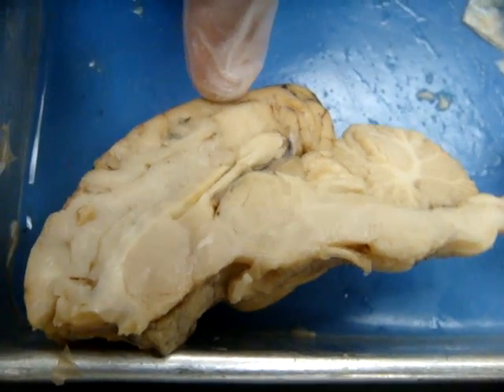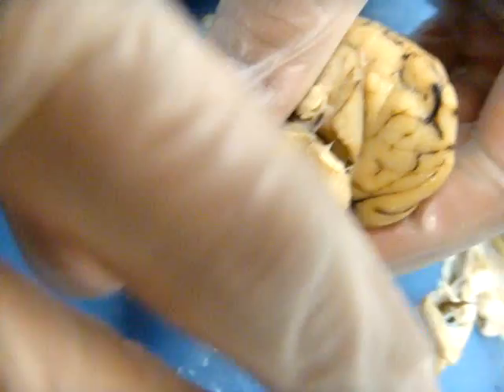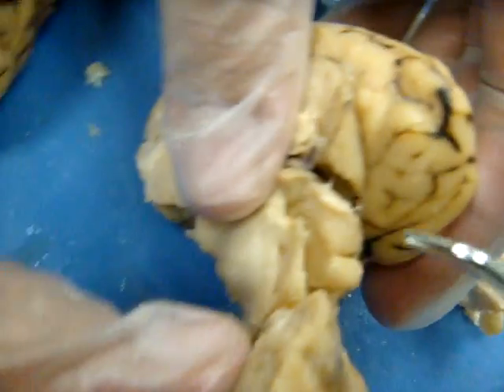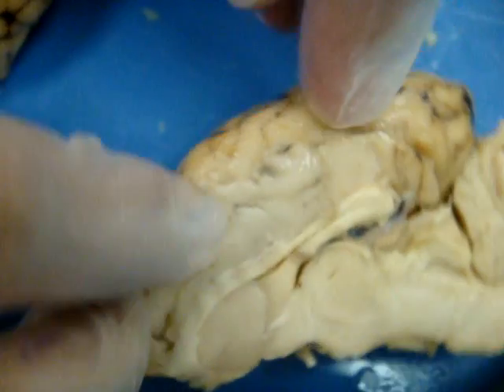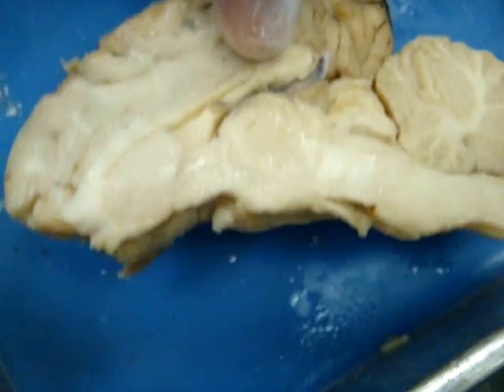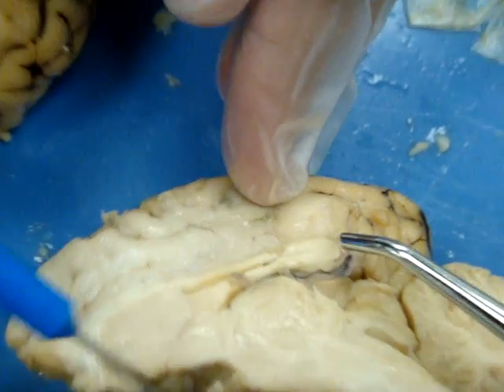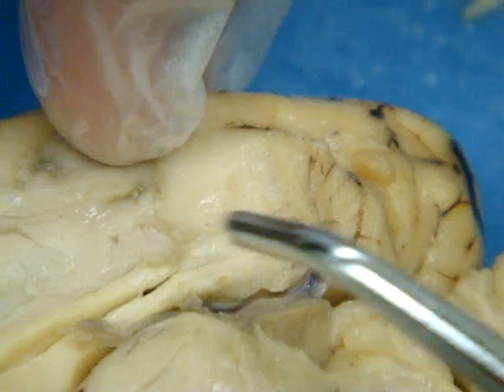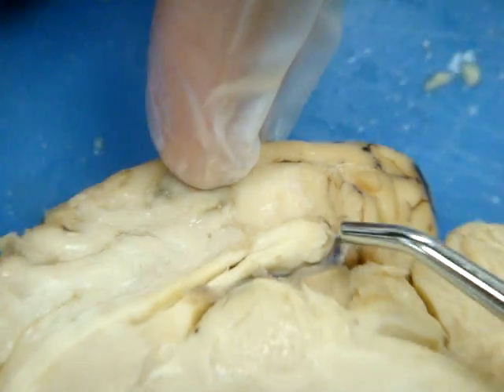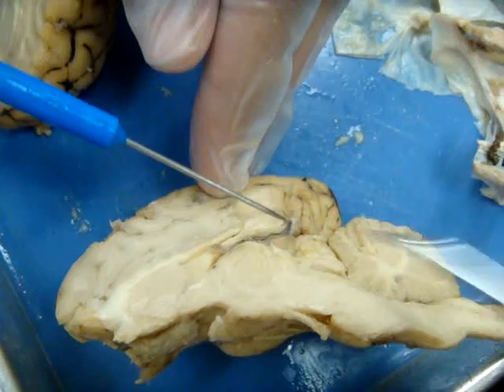Corpora quadrigemina — do you want to pull back the cerebrum, between the cerebellum? Here's the superior and inferior colliculi. And the pineal gland is right here on this side, just a little bit right there, kind of at the top angle of the lateral ventricles.